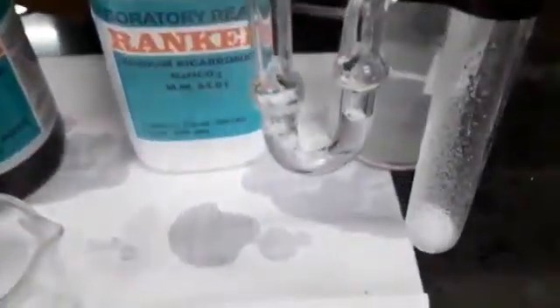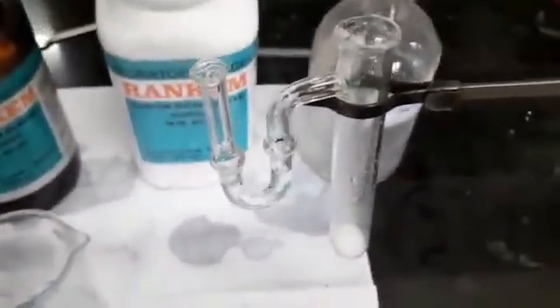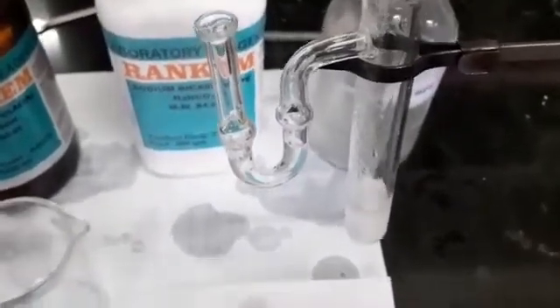You can notice it here. Now we are adding vinegar to the baking soda. The gas has started producing.